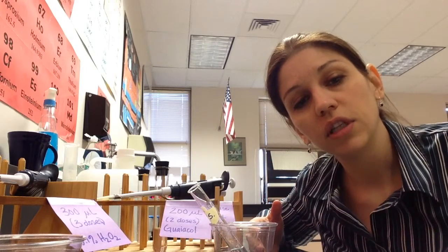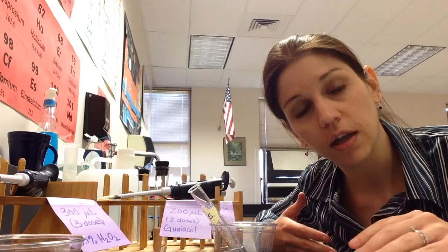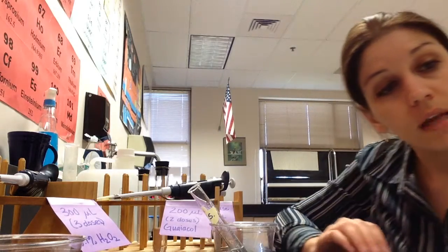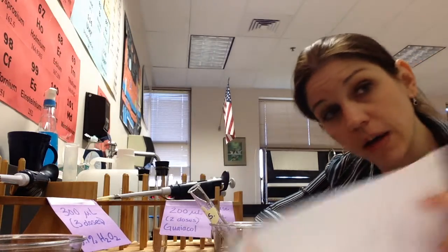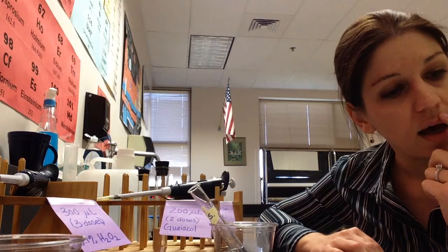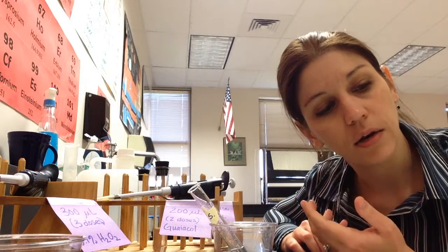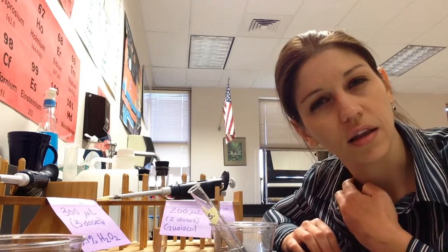And so if you looked at step 4 in your lab notebook, it said to record the color, which is the absorbance, at 1 minute increments. I do think that we can probably do better than that because we have the spectrophotometer. And so I think that you're probably best to do it in 30-second increments rather than in 1 minute increments. It's just going to give you more points to plot, and I think that that will be useful.